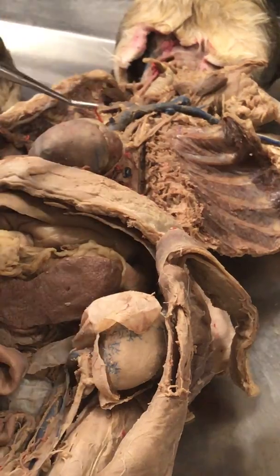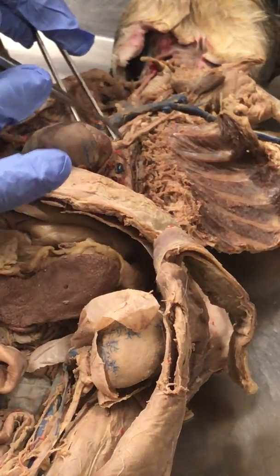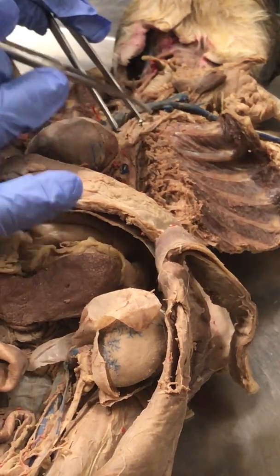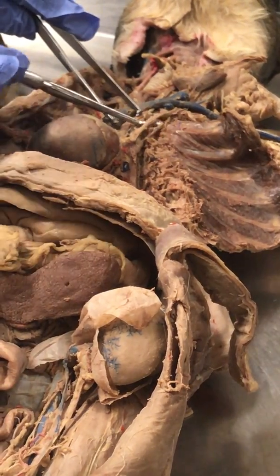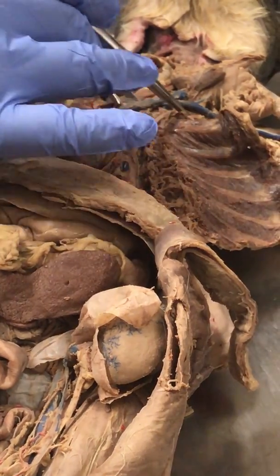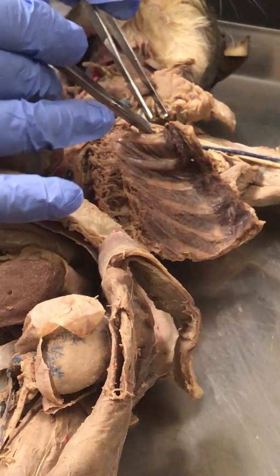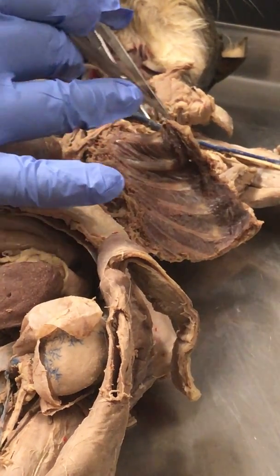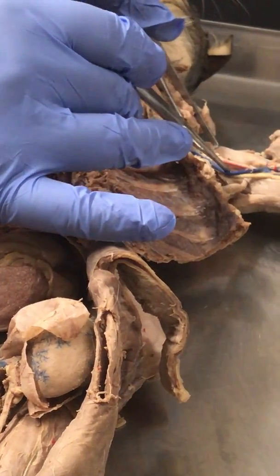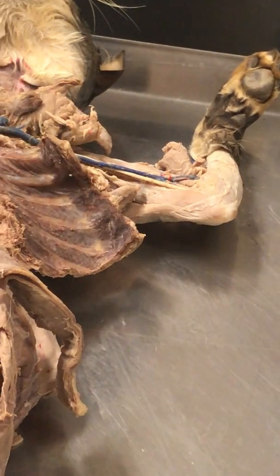Okay. Now, if we follow the left, the second branch that comes off of the aortic arch on the cat is the left subclavian artery. Follow the left subclavian. Once it passes the first rib, it then becomes this one here, and that is the axillary. And then from there, if we take a look here, that is the brachial artery. They really follow the same names of arteries and veins.